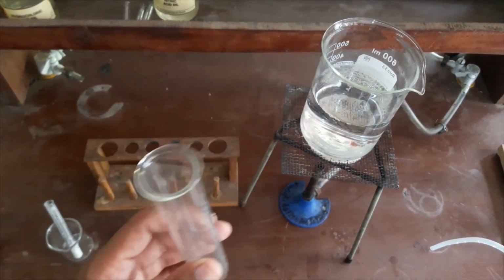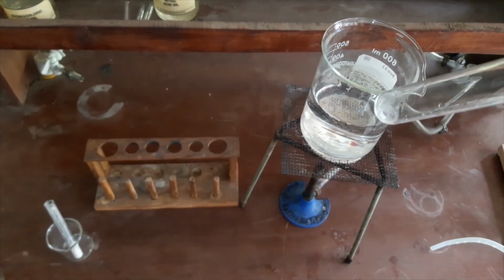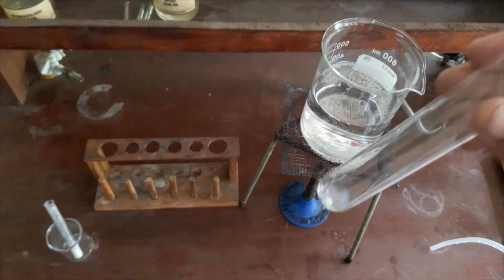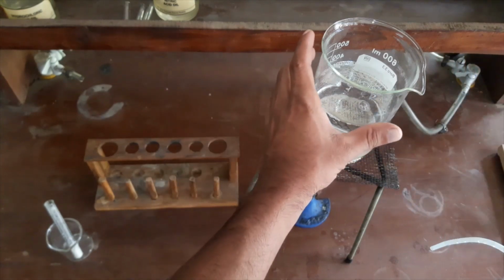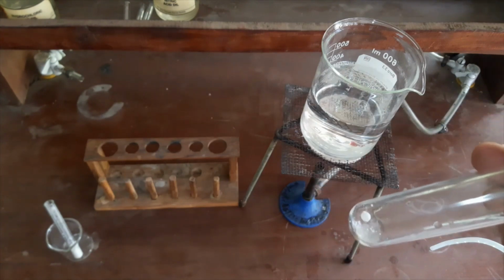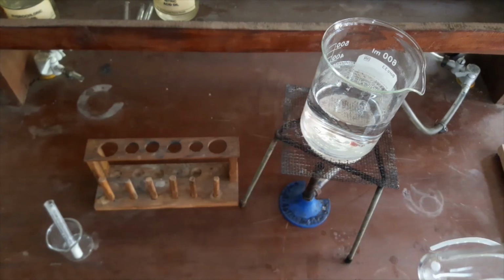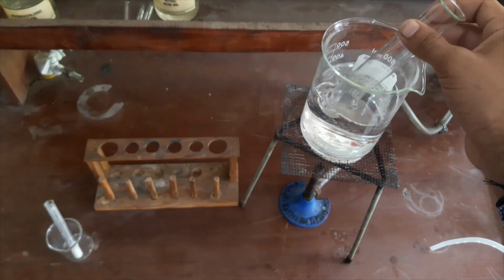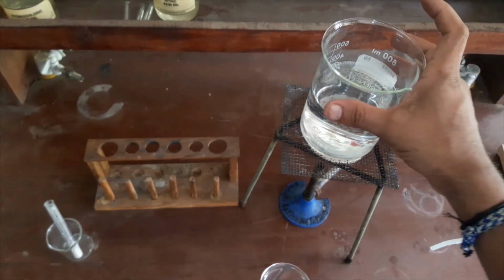I will do our second step. We have to heat this. Normally we use a water bath. Actually, here we are using distilled water, so we can heat this tube by using direct flame. But if we are using another chemical, methanol, ethanol, or anything other than water, if we are using any organic chemical, we will use a water bath, and we will heat the water bath and dip our sample in the water bath to heat it. If we are using distilled water, it doesn't matter, you can heat it by using direct flame.